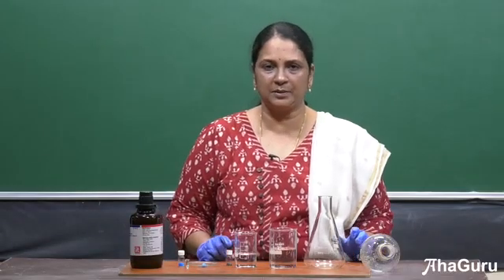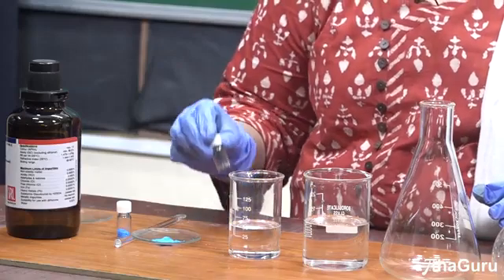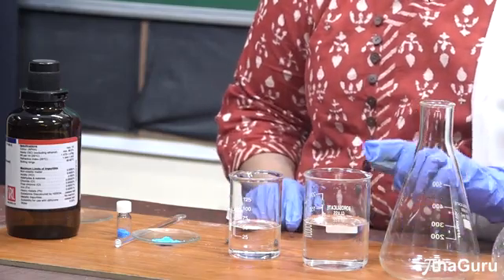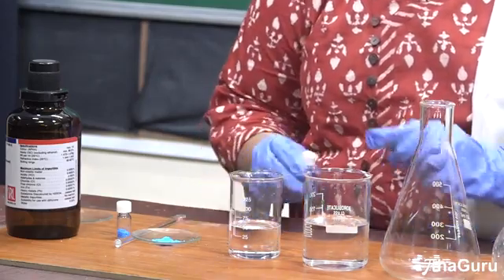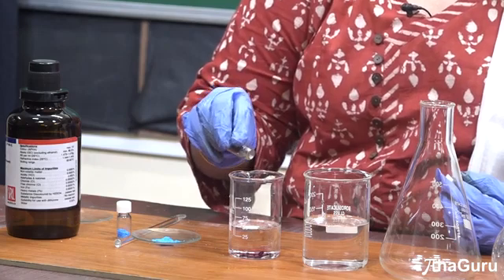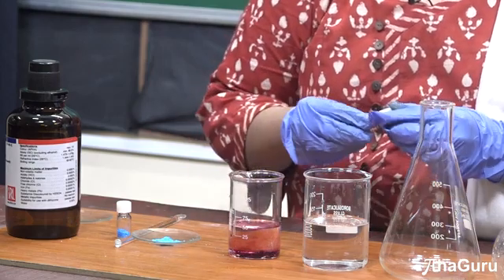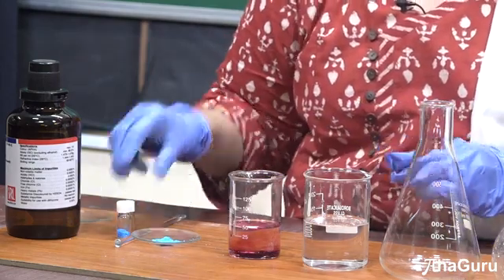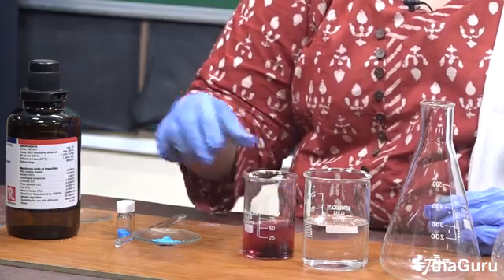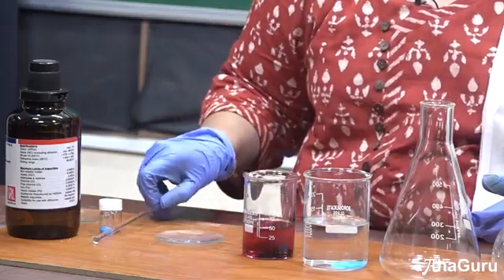I am going to now show you another small experiment to separate a polar and non-polar compound. Here I have taken iodine, which is completely non-polar, and copper sulfate, which is polar. Again I have taken two solvents: water and chloroform. Iodine will be completely soluble in chloroform — you can see how the color is changing. Though iodine is a solid, it is easily soluble in chloroform. Copper sulfate I am adding in water so that it will be soluble in water.